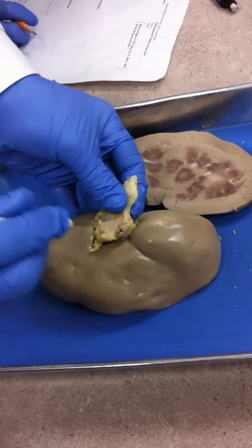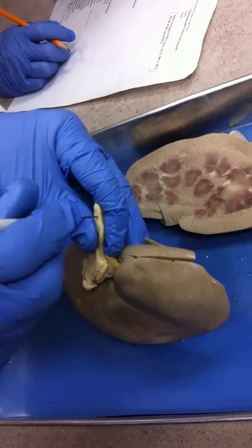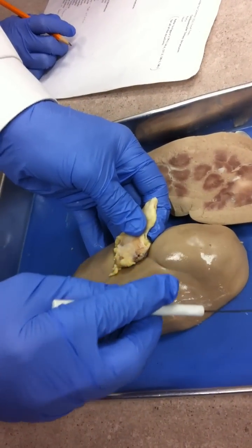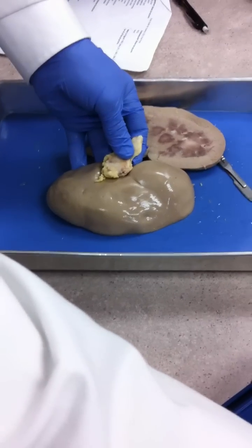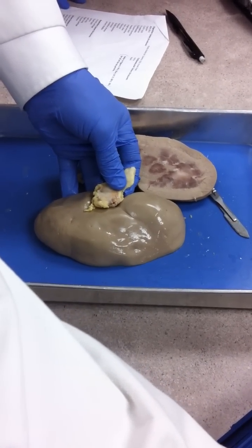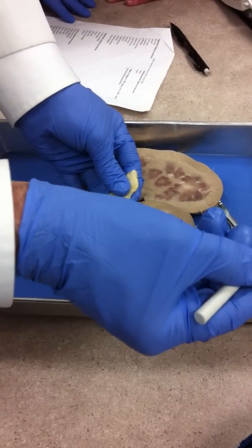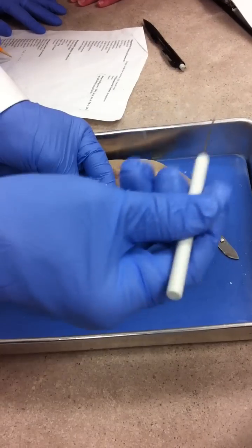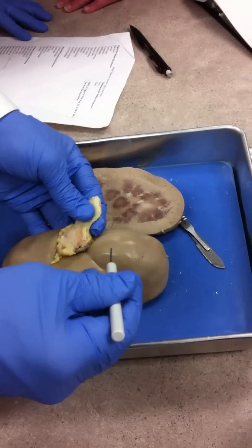Do you guys follow that so far? Ureter — I'm going to use a different kidney, this one is kind of hacked up. Look at the picture in your lab manual. You'll have two pins next to each other — those are your two blood vessels. The one with the bigger lumen will be your renal vein, the one with the smaller lumen will be your renal artery. And with the biggest lumen out of all three, look for the adipose tissue — that's the ureter itself. The ureter is composed of a lot of adipose tissue.